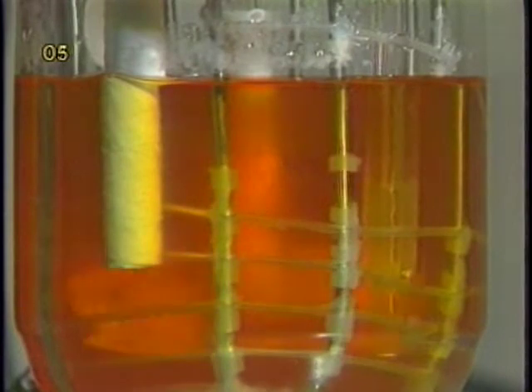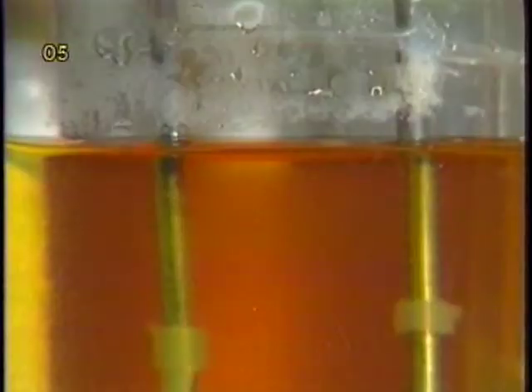The use of microcarriers in cell culture poses somewhat different agitation requirements than for free cell suspensions. The diameter of microcarriers is in the range of 150 to 200 microns, as opposed to 10 to 20 microns for free cells. The terminal settling velocity of microcarriers in cell culture medium is almost two orders of magnitude higher than that of free cells. This implies the existence of a much higher relative velocity between the microcarriers and the fluid than between free cells and the fluid. Cells on microcarriers therefore experience a higher fluid shear force than free cells do.